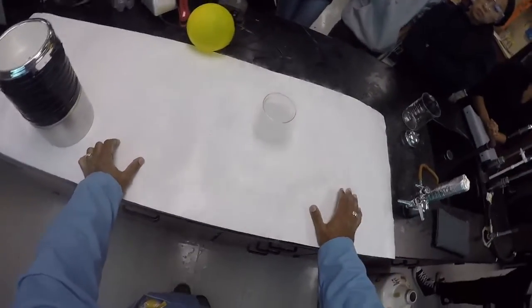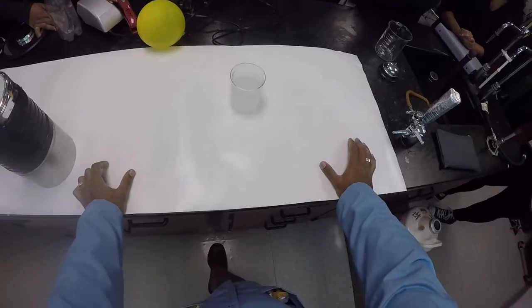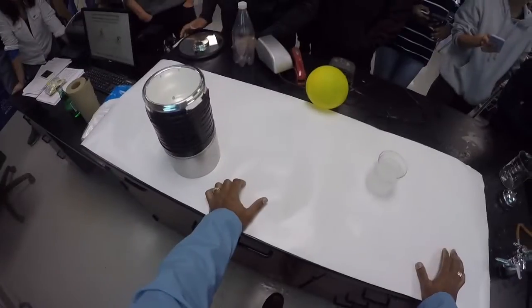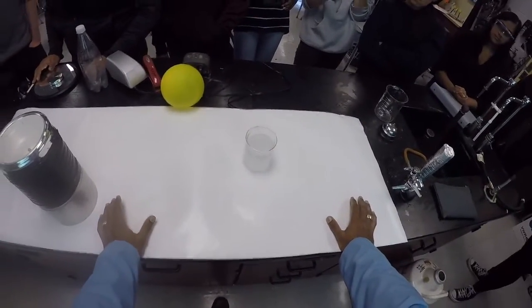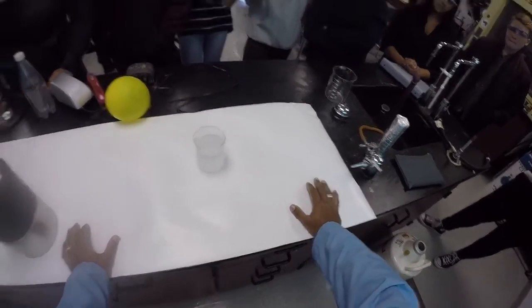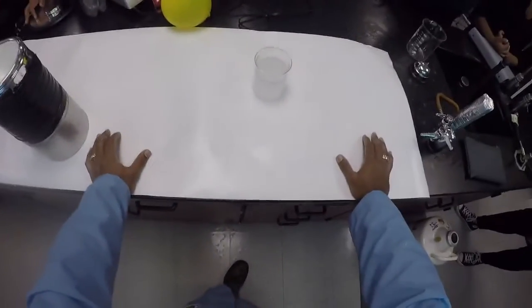Now you're probably noticing that it doesn't look like it's boiling as vigorously as it was before. And the reason for that is because the first time I poured it inside there, the beaker was about room temperature. When I pour the liquid nitrogen inside the beaker, it equilibrates with the temperature of the liquid nitrogen, so that no more heat is flowing into it. Remember, if the beaker is warm and the liquid nitrogen is cold, heat's going to move from the beaker to the liquid nitrogen, right? And it's going to cause it to vaporize and boil a lot quicker. But now it's about equilibrated. But it's still very cold and really dangerous, right?